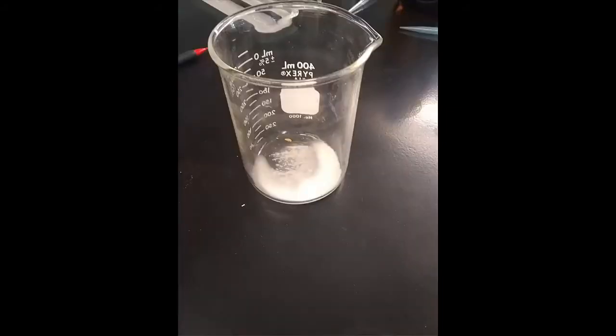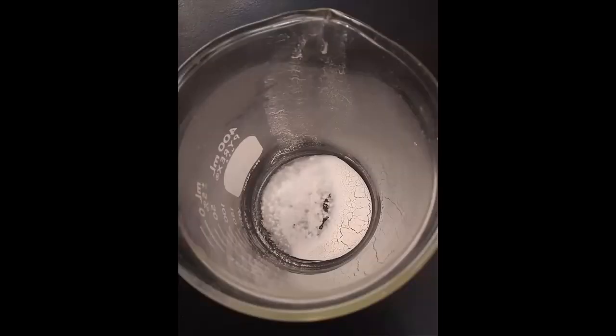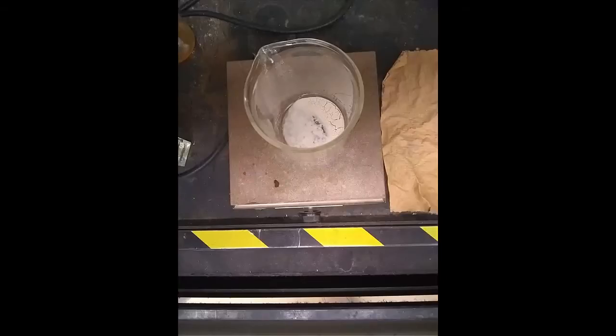This is after decanting, again after decanting, letting it dry for a little bit. Just another picture of what it looked like after we decanted for the second time. And this is when it's a little bit more dried. We put it on a hot plate to dry it just a little bit more.